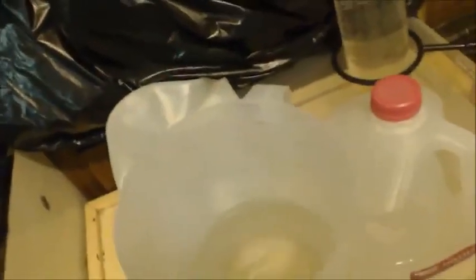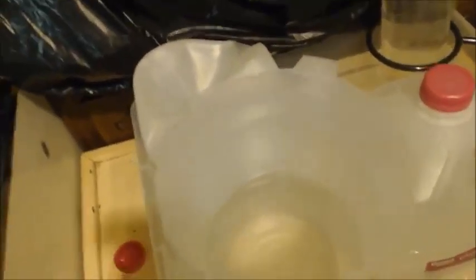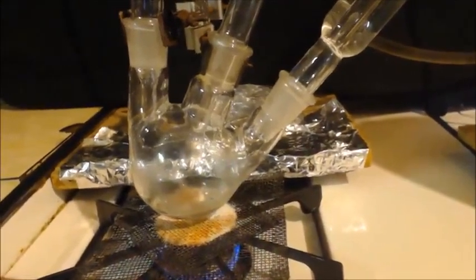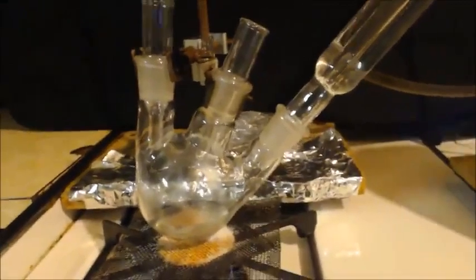And on this, it measures stuff real good, I forget what that's called. It's inverted too and it's full of water. You can see there's just a little bit of air there, but other than that, it's filled up. I'm thinking that maybe the first stuff that comes over, I put into there, because it's going to be a lot of air. Propene gets made and it just pushes the air out of the way into where I'm collecting. But then after that, I can fill up the gallon. So that's say, four liters, five liters. And no crap, 5.6 liters, well I probably won't make a full amount. All right, so I'm going to start up the heat. I'll get back to you, I got to get this all the way up to 170.